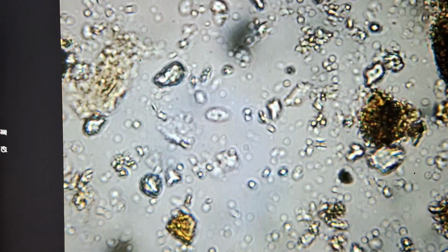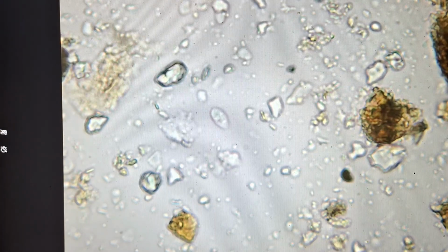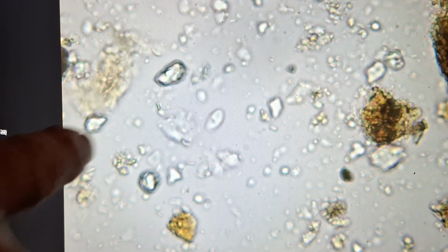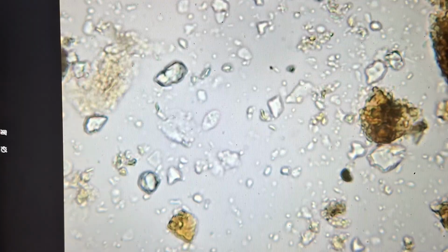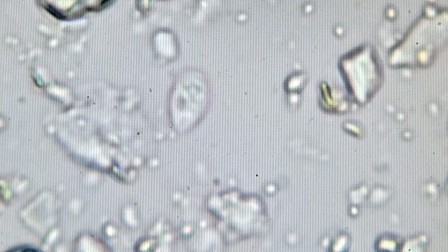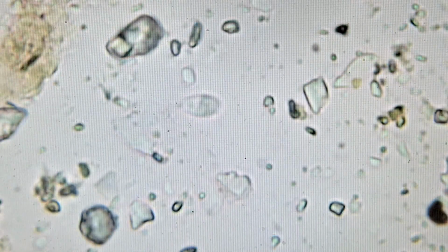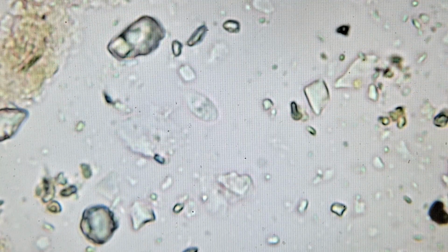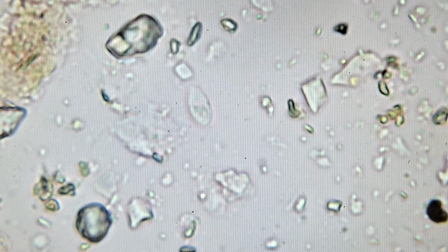There's naked amoeba and shelled amoeba. I thought this was a shelled amoeba. We'd see a shell around it. But I'm seeing a little flagellum, a little tail out the end of it here. We're just barely able to make it out every now and again. Little whip-like tail sticking out the end of it. Let's see if I can zoom in with a camera. Too much. Just barely make out that flagellum sticking out the end of it. That's also feeding on these bacteria and these fungi around.